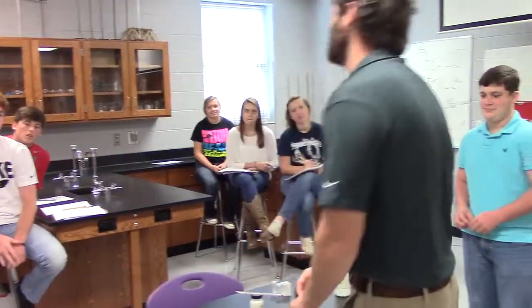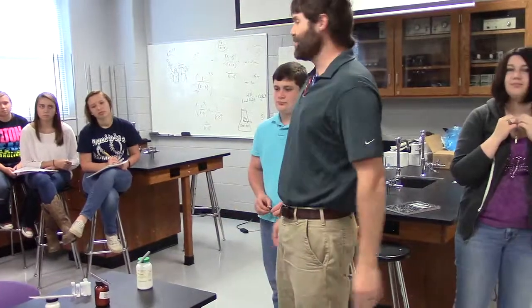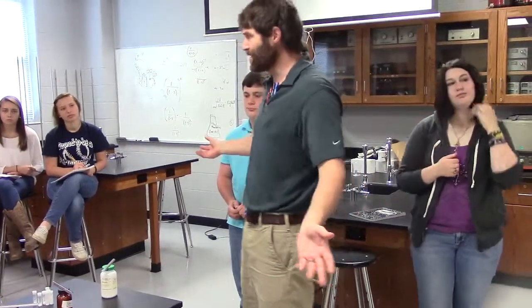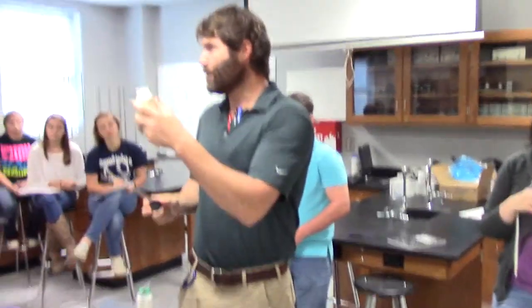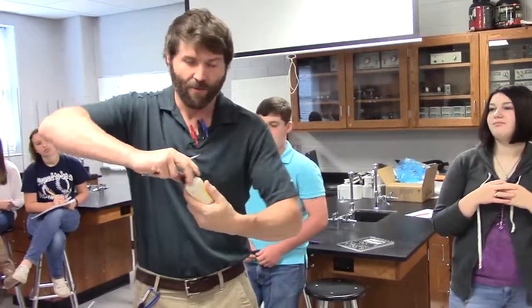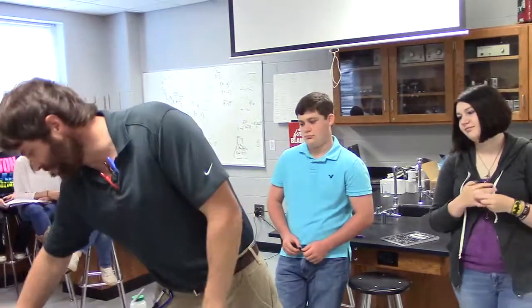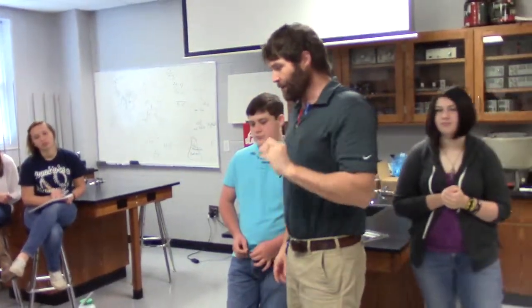By the way, please make sure you put the lids on tight. Some of this stuff, calcium nitrate, will literally turn to liquid. It'll suck moisture out of the air. One of you will come over here and be like, Mr. Cole, it's water. No, it's calcium nitrate. It's dissolved from moisture in the air, which is why you need to put the lids back on and store those with them. Now, I do have a couple of little exceptions.